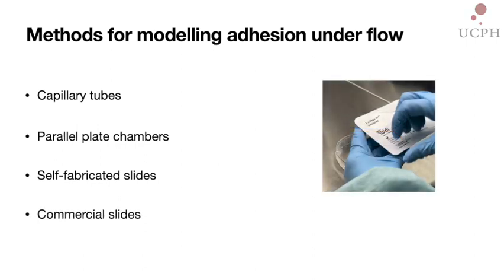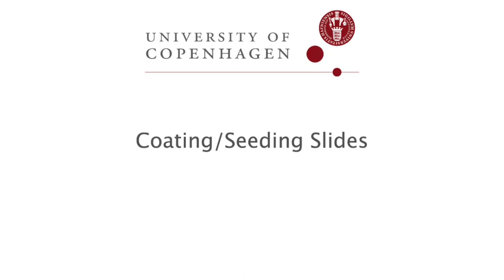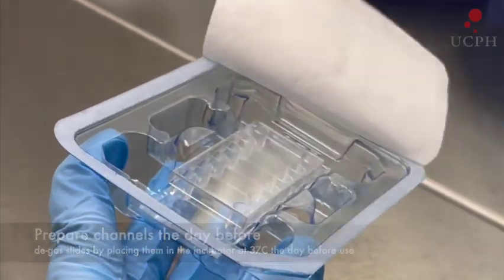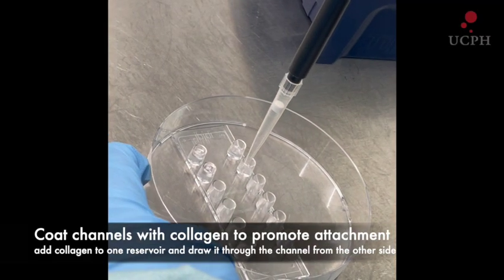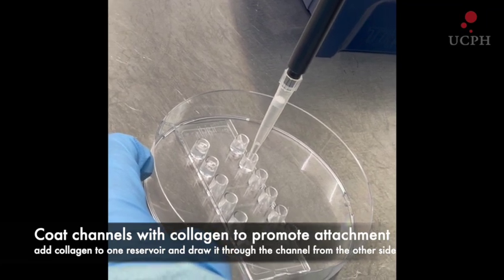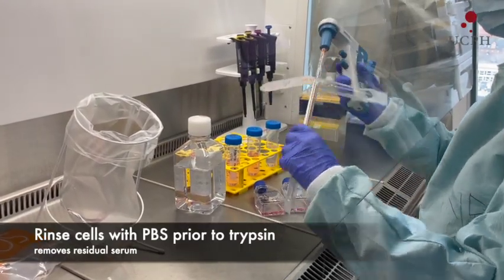Using the following protocol will allow you to assess the ability of malaria-infected red blood cells to bind to endothelial cells such as primary HBMEC or the immortalized HCMEC D3. The following protocol uses microslides from Ibidi. While slides are being coated with collagen, start to prepare the cells for seeding.